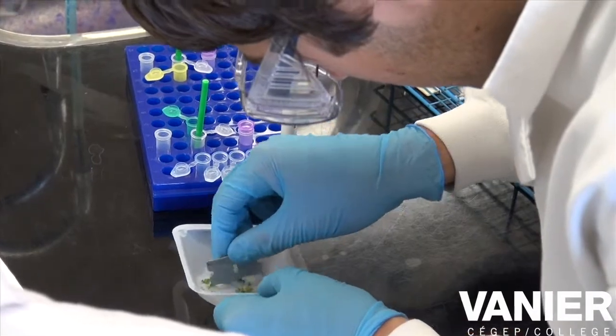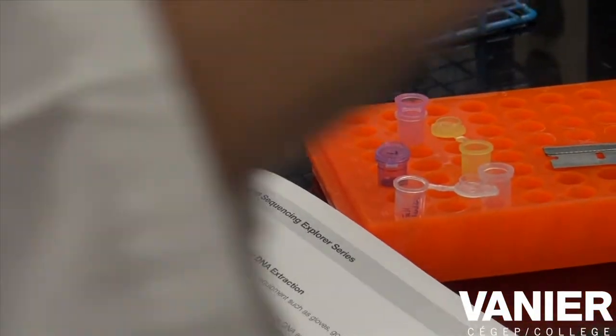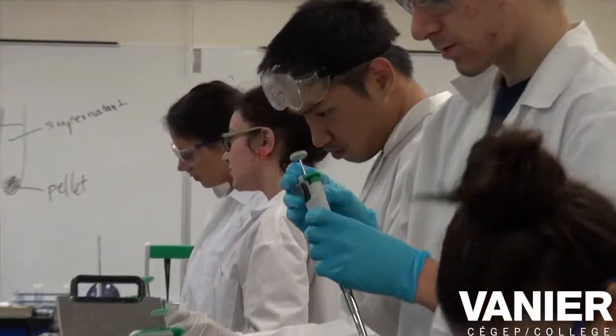Is there another unit? Yeah, exactly. I need to try some more. It's 200 microliters.